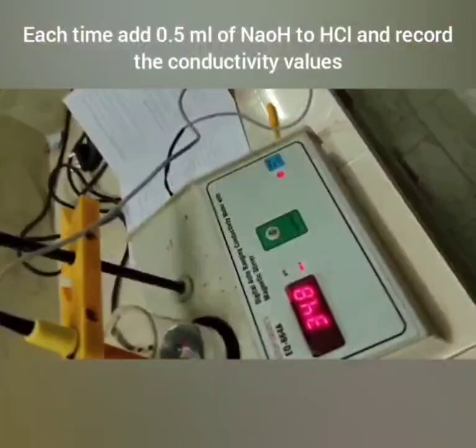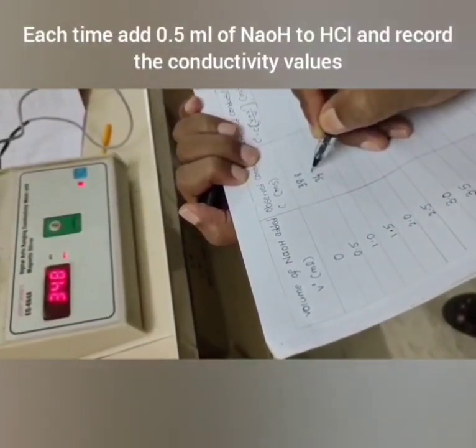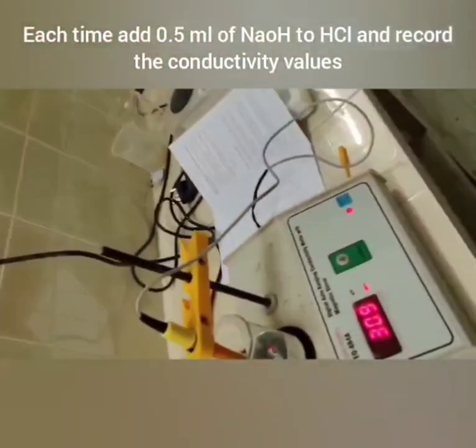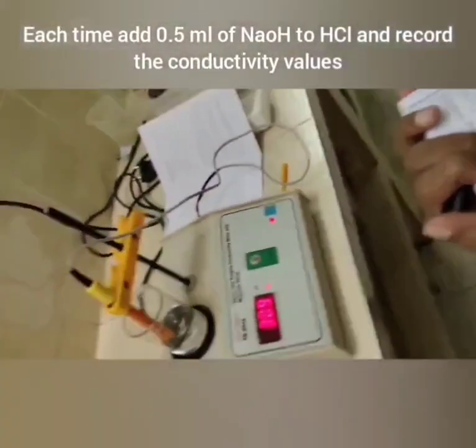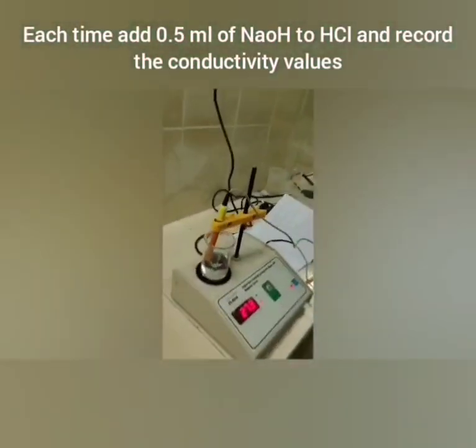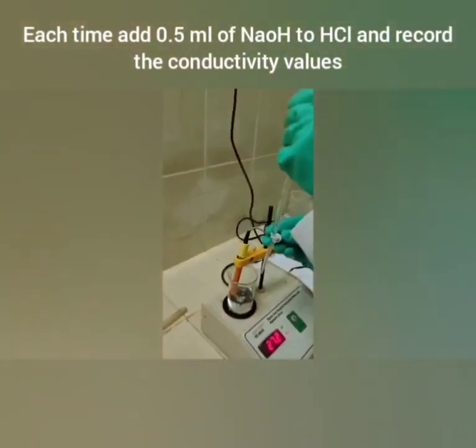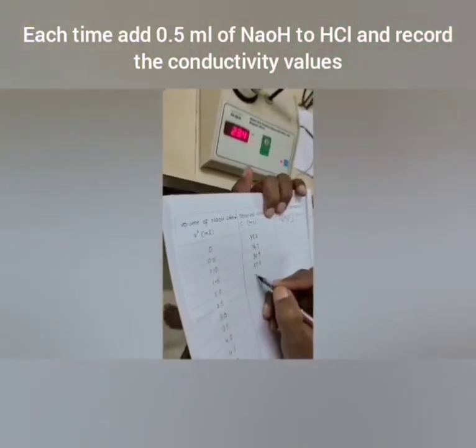On each addition, we have to add 0.5 ml of NaOH to the HCl solution present in the conductivity cell. For each 0.5 ml addition of NaOH solution, we have to record the readings at 0.5, 1.0, and so on. There is a decrease in conductance values due to replacement of more mobile H⁺ ions by Na⁺ ions.